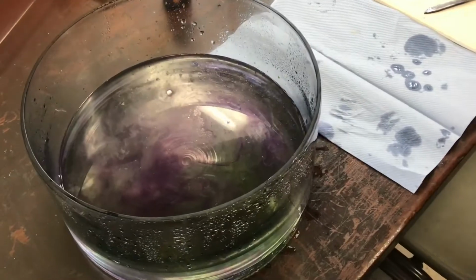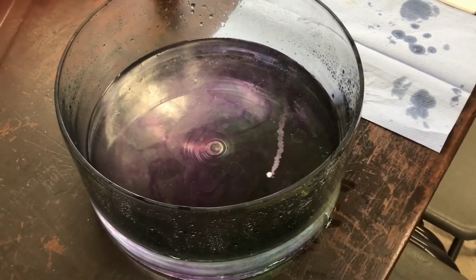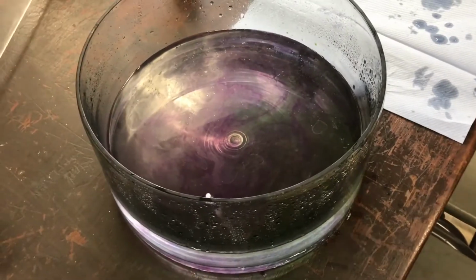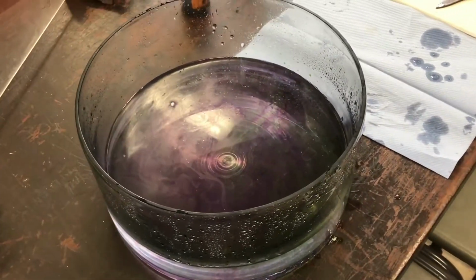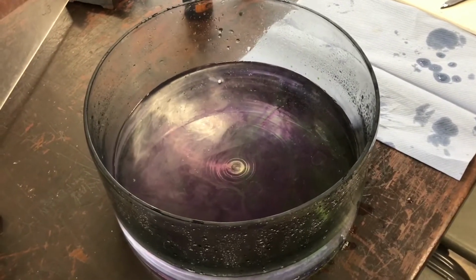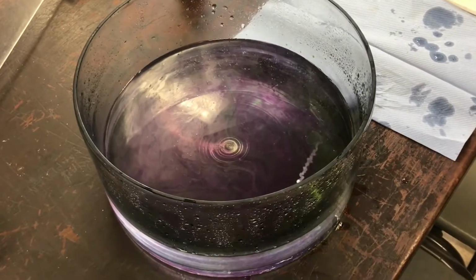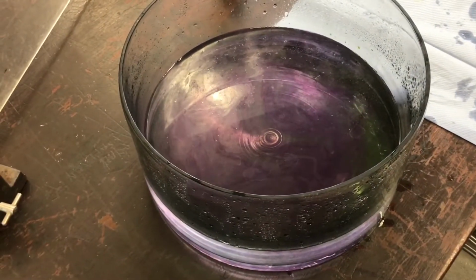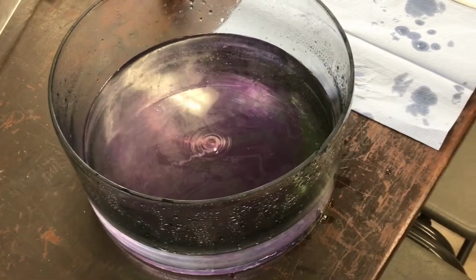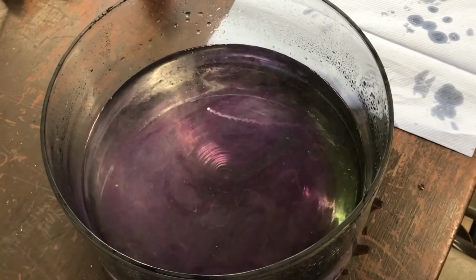And why am I keeping it away from the outside of the bowl? Why do you think? Yep. It's because of the heat. Yes. And it's quite dangerous what I'm doing, keeping it away, but I would like my bowl to remain intact, so I'm keeping it away. And we're now down to a very small ball bearing size as it continues to react. There we go. Can you see it? And again, we have a very strong alkali solution.